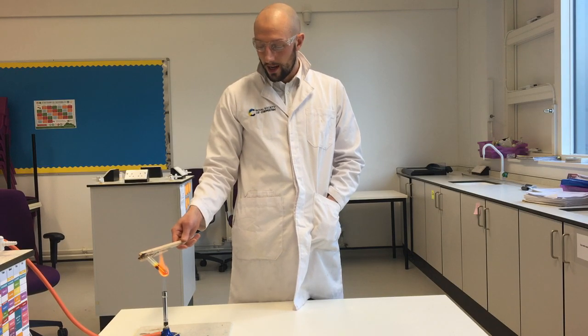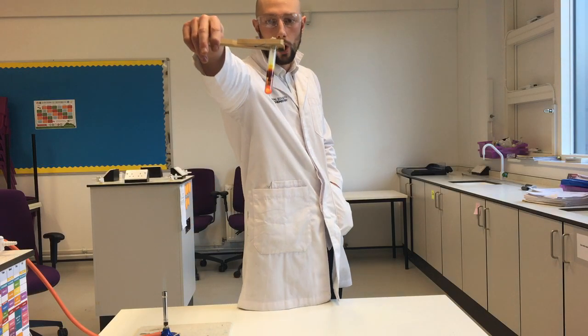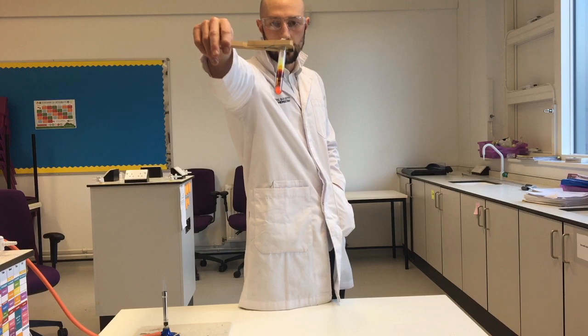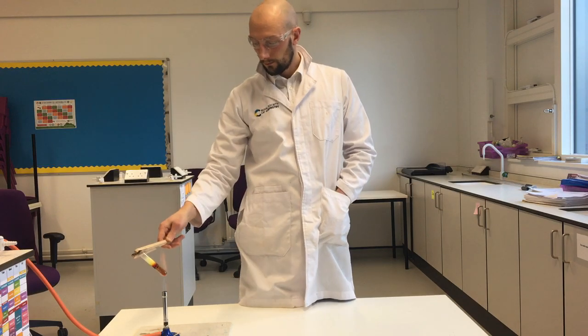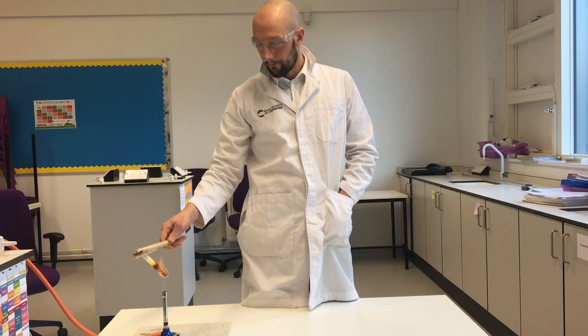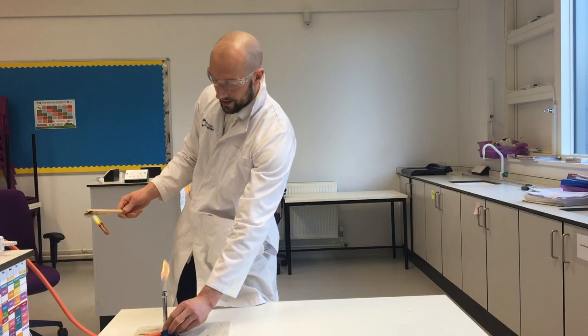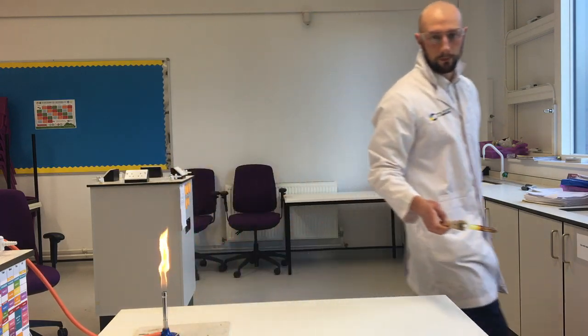In this reaction, it's getting very hot and the atoms are chemically joining. I can see it's glowing red. I hope you can see that as well, my bright red glowing mixture in my test tube. I'm going to do it for a little bit longer so that atoms can chemically join. And that has finished glowing red now, so it must have finished reacting. I'll put my Bunsen back to my safe yellow flame that I can see. I'm going to put this down to cool.